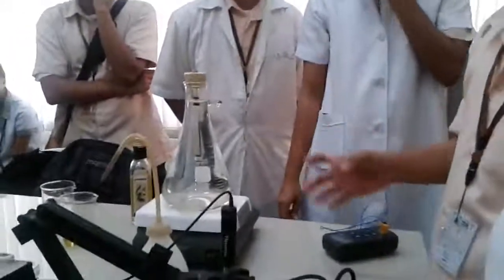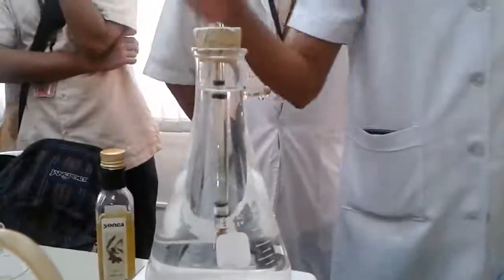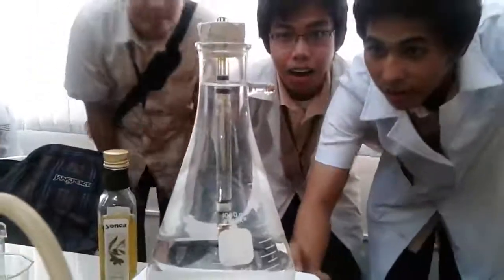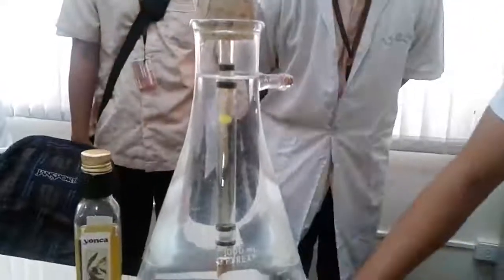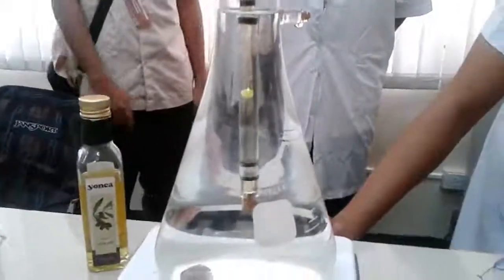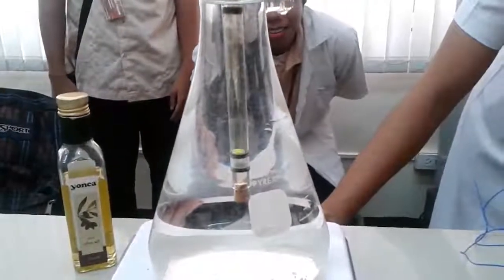So, assuming we have ambient temperature, stop.